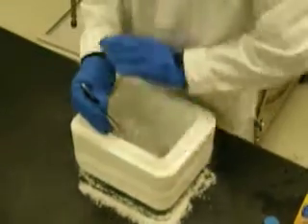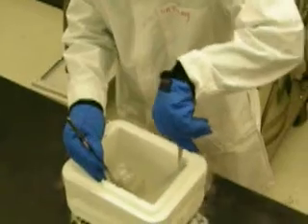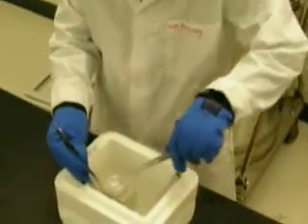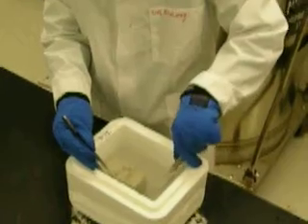Oh, shit. You dropped it in. Don't record. I'm being unsafe. No, you're being safe. Glass. All your skin is covered. You have your little face shield on. You got the cryo gloves on. So if it splashes, it's not going to burn you.